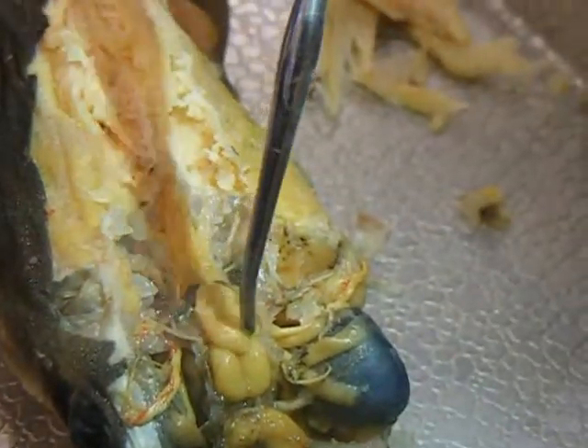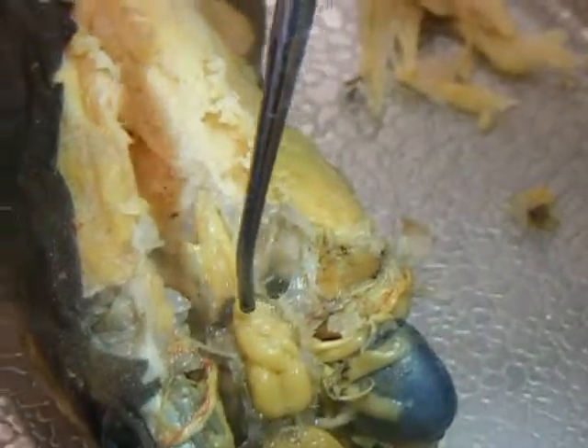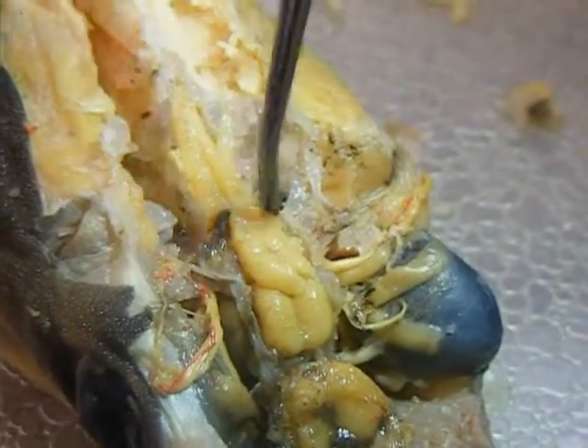The anterior lobe is closer to the front. If you look carefully you can see like a cross — well, on ours it's kind of smeared. The anterior part is the front, and then you have the posterior part on the back.